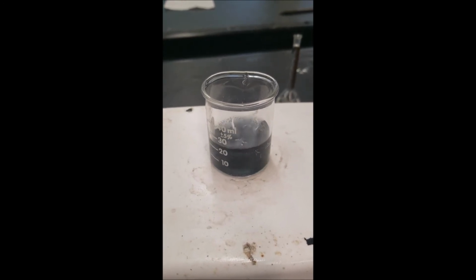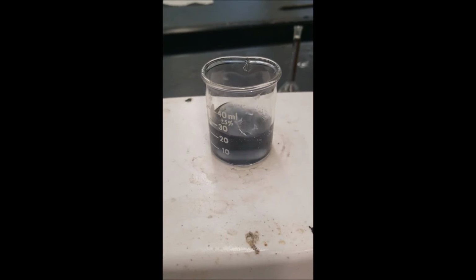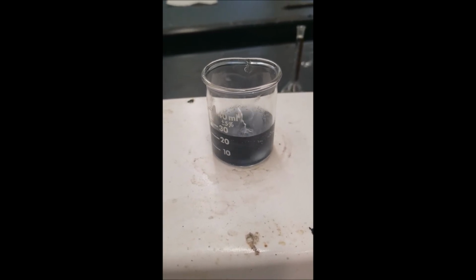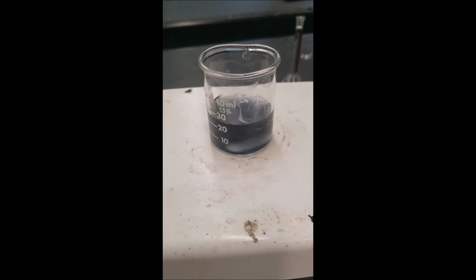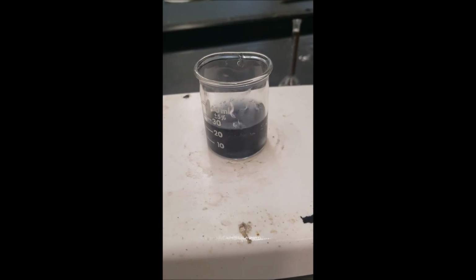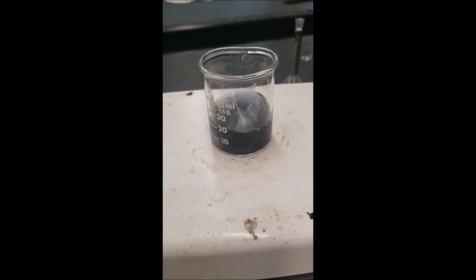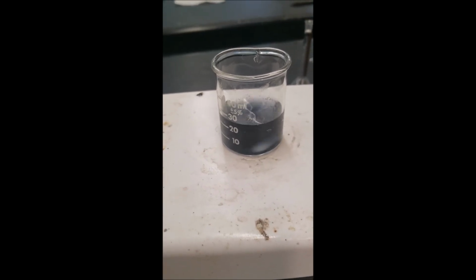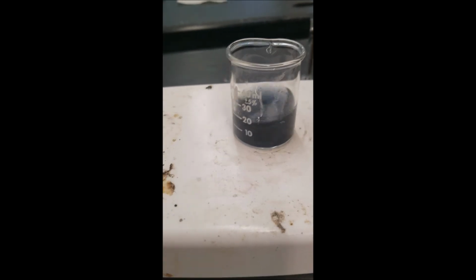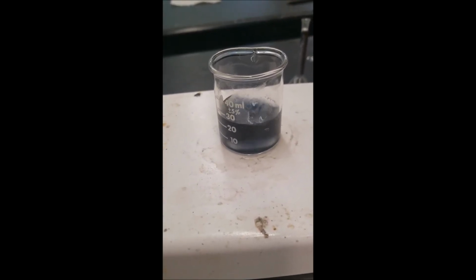We saw a large iodine buildup, and now it's formed the I3 starch complex, and it doesn't seem to be changing. I'll look back at this in a few seconds, but I don't think it's going to change anymore. So despite all the peroxide and all that, you're seeing almost irreversible buildup in the I3 starch complex.